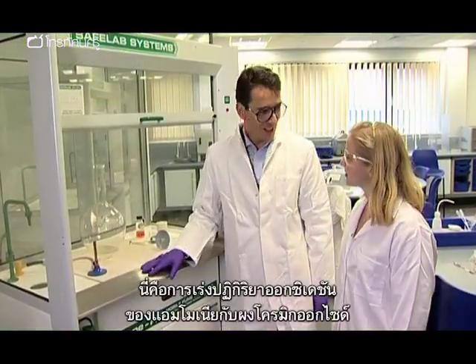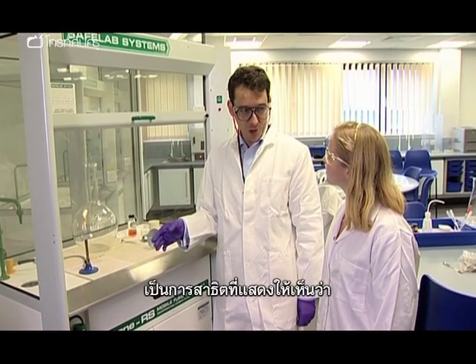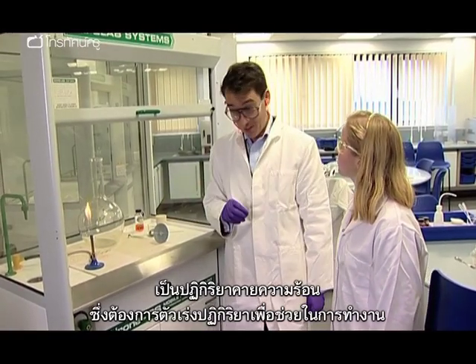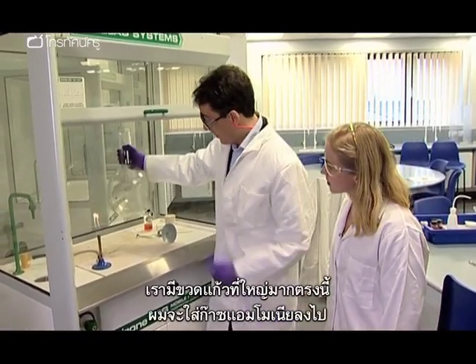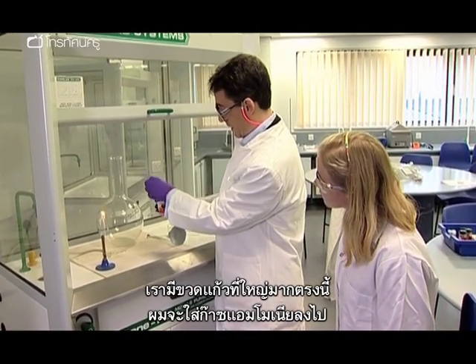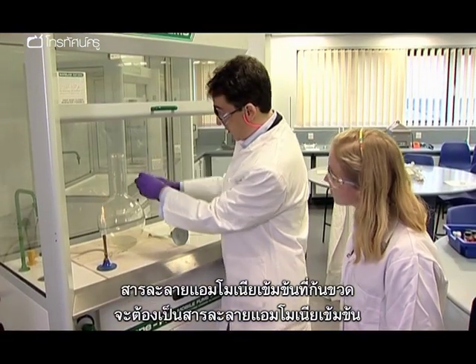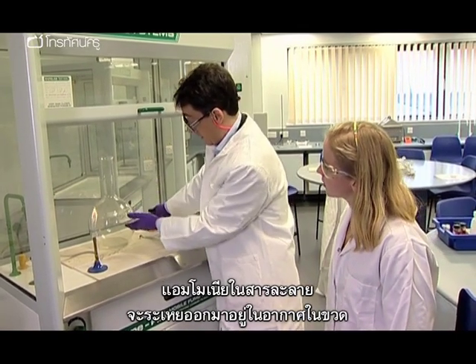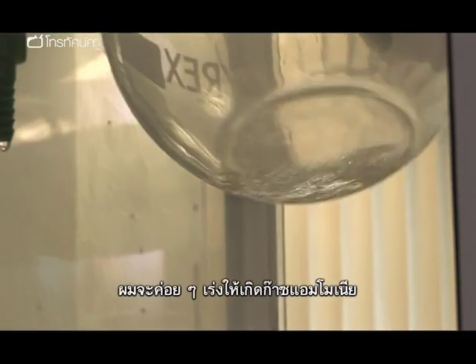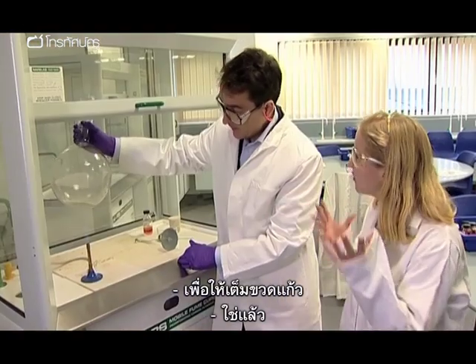This is the catalytic oxidation of ammonia with chromic oxide flakes. It's a really nice reaction to show how ammonia can be oxidised with oxygen in the air. It's an exothermic reaction, but you need a catalyst to make it go. I've got this really nice big flask, and I'm going to put some concentrated ammonia solution in the bottom. Because there's so much ammonia in solution, you get ammonia vapour being released into the air in the flask. I just gently warm it up, really trying to encourage the ammonia gas so the vapour really fills the flask.